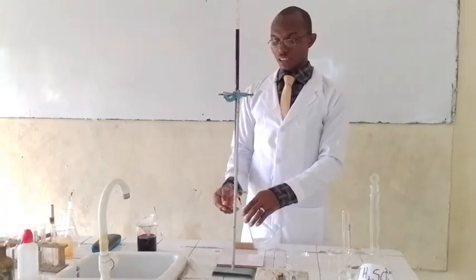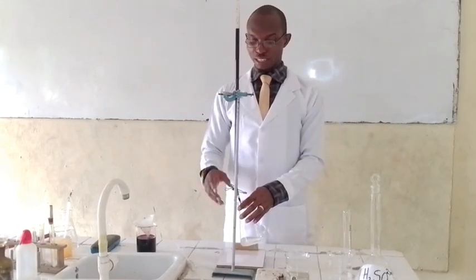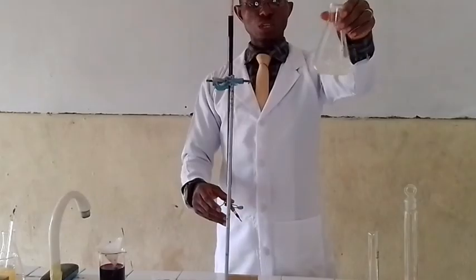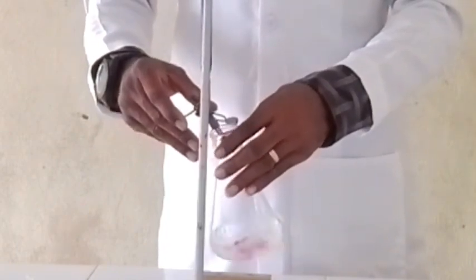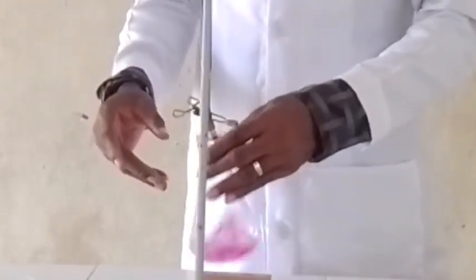On the base of my retort stand there I have a white tile that is going to help me identify the end point of the reaction. Gradually I will start dispensing my acid into it while I swirl gently. You can see — the more we add acid into it, it disappears. Our acid is going into it and it is disappearing, because it hasn't reached the end point yet. We swirl gently as we add our acid. We have a color change — our acid has reacted with our base, and that brings us to the end point of this particular titration.